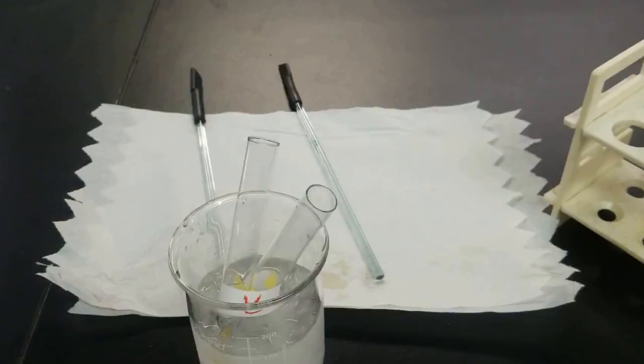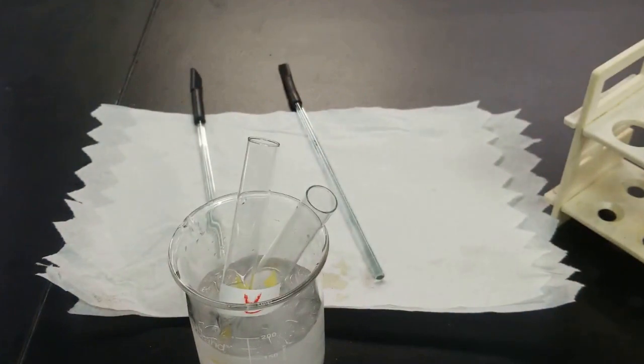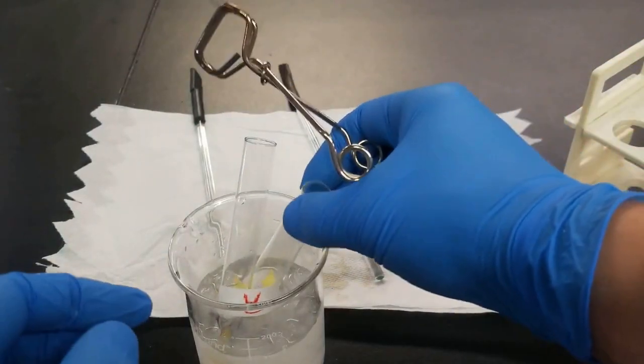All right, so I've had them sitting here for a couple minutes. The next step, I'm going to take them out, hold them at a 45-degree angle, add about 1/2 milliliter of concentrated sulfuric acid, doing it very slowly. What I'm trying to do is basically make 2 layers. Let's see how this goes. Start first with our known.